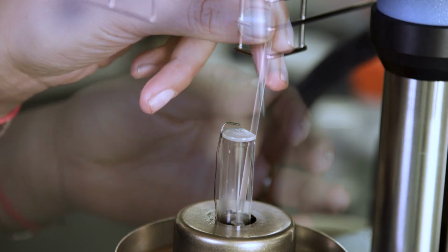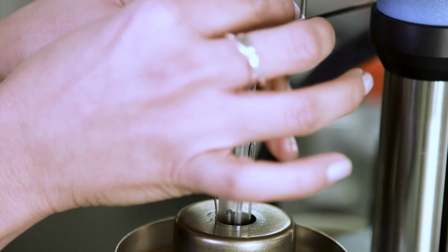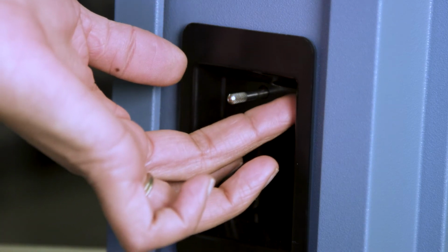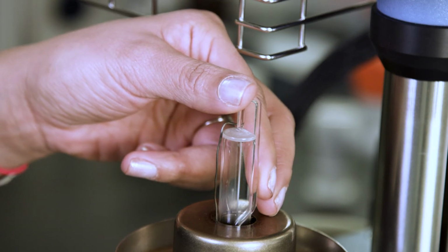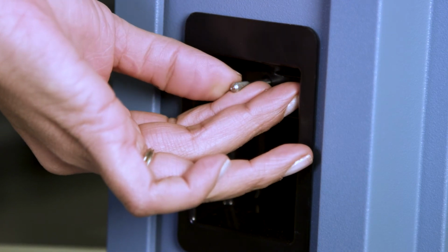The probe to be installed is the penetration probe. Insert the end of the probe into the opening in the back of the stage. Hold the weigh tray in the upper corner and continue lowering the probe into the stage until you feel it sit in the locking mechanism. Tighten the probe locking lever by turning it clockwise.